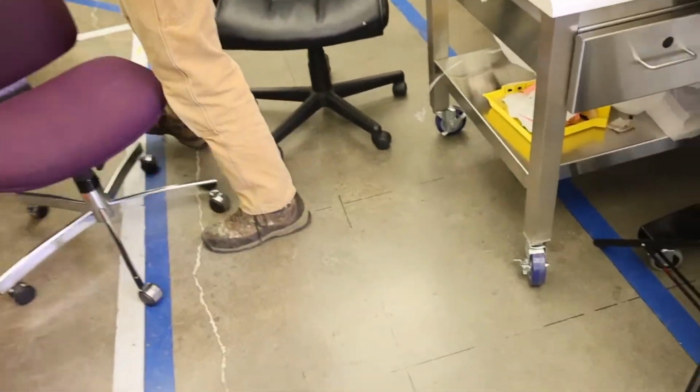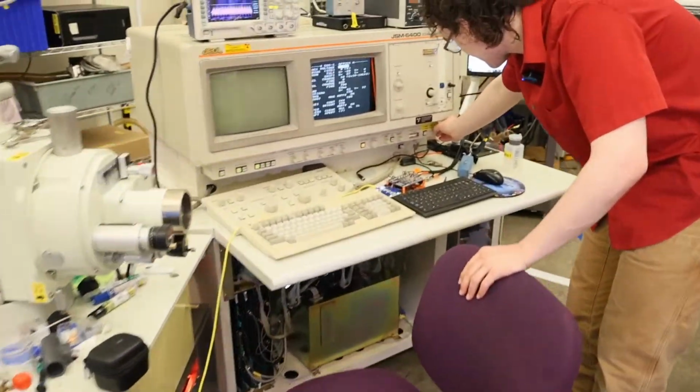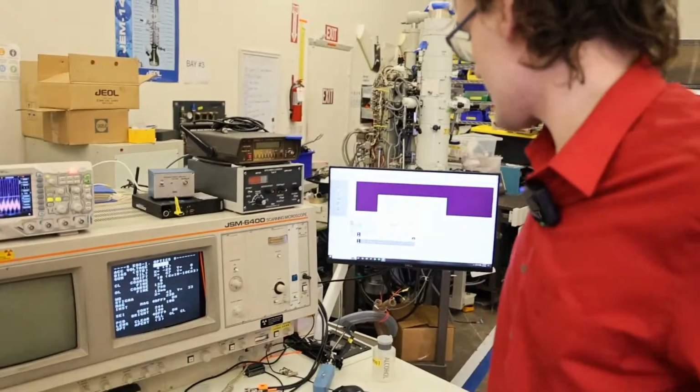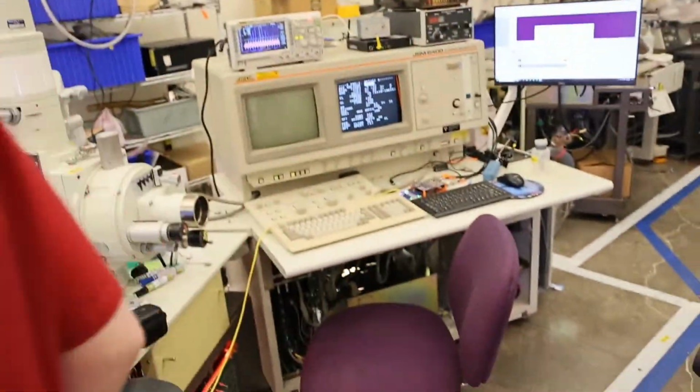Thank you. So first thing we're going to do is turn off our high voltage so that we're not working around the detector and electron source high voltage while we're back there. So high voltage is off, so we'll go ahead and plug some cables in.